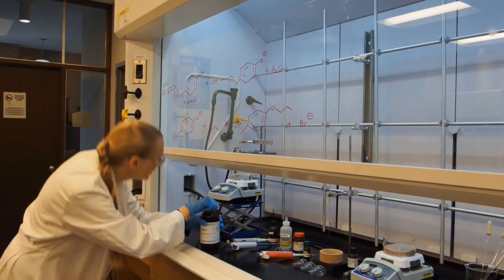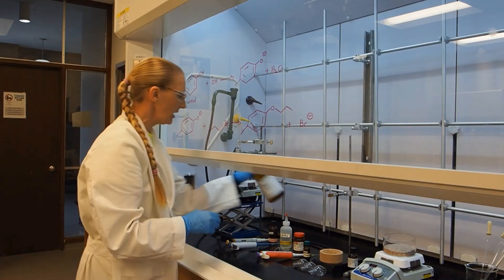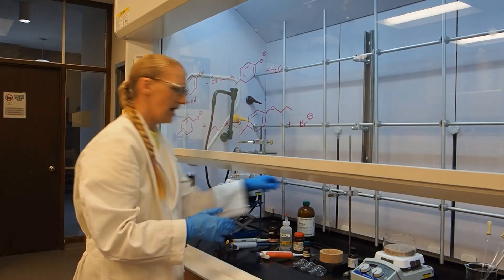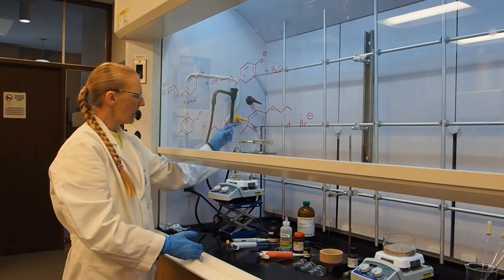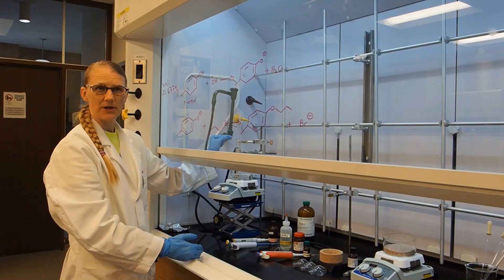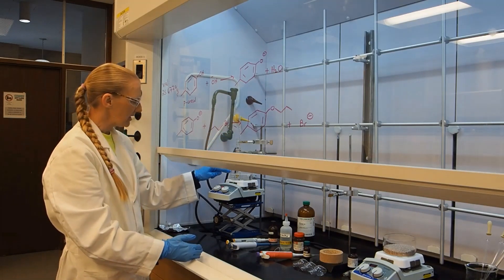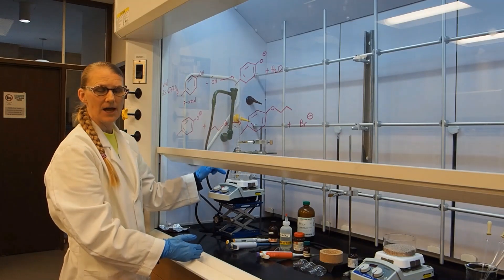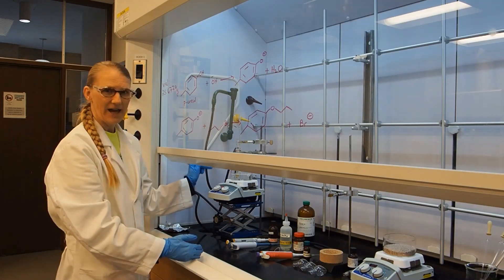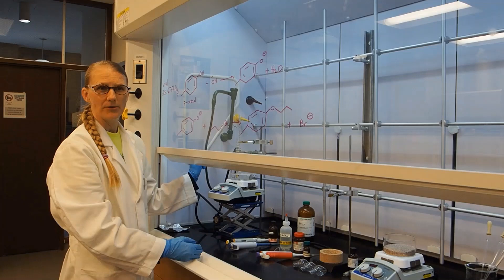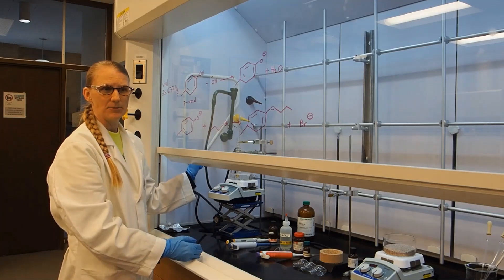So I'm adding enough oil so that the oil level is even with the level of the solution in the vial. Now I'm going to turn the heat up, and when the heat on this thermometer reaches between 110 and 115, I should see the water in my reaction boil. That's when I will start the reaction time of 45 to 60 minutes.